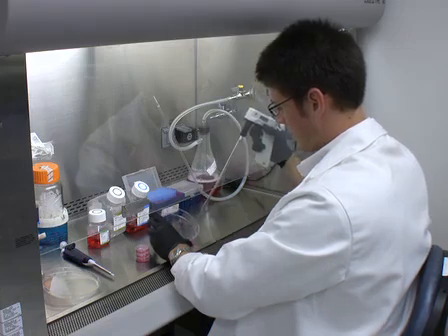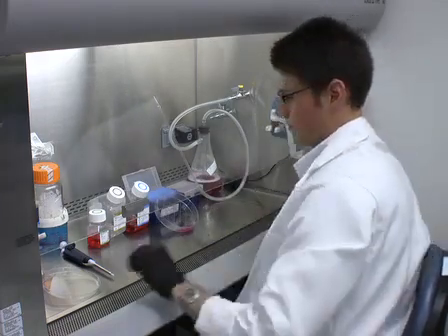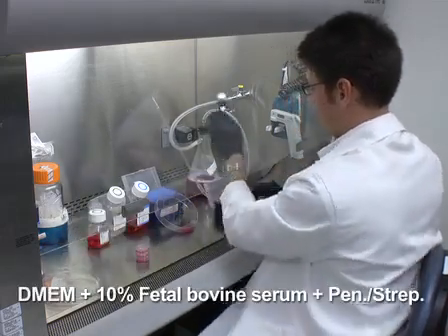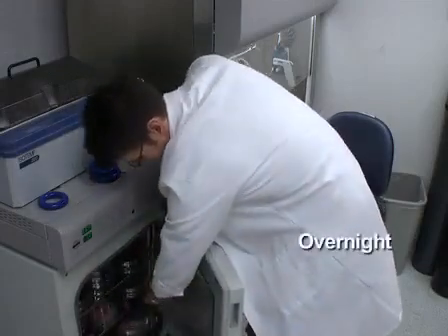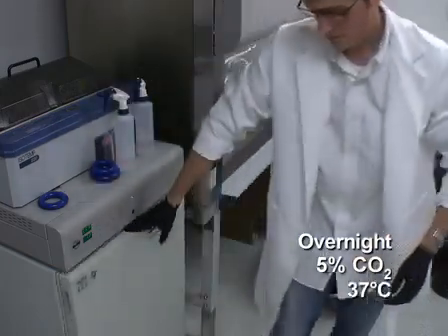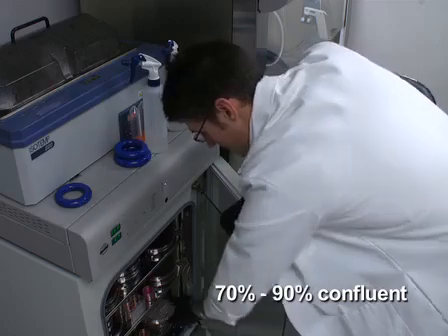To prepare cells for transfection, under a tissue culture hood, split EAHY926 cells grown in complete DMEM into cover slip lined 35 mm dishes with 2 ml of medium. Prepare one dish to evaluate expression of each individual receptor, as well as one dish for each receptor pair. Allow the cells to incubate overnight in 5% carbon dioxide atmosphere at 37 degrees Celsius. The following day, the culture should be around 70 to 90% confluent.